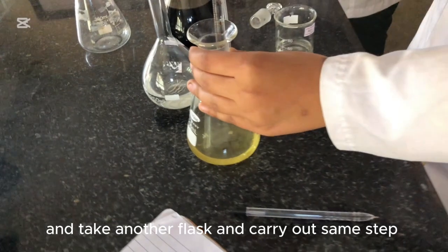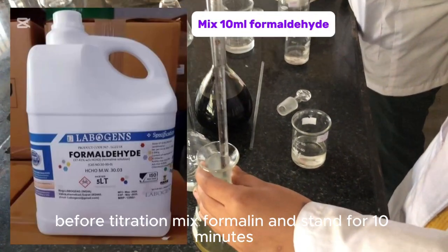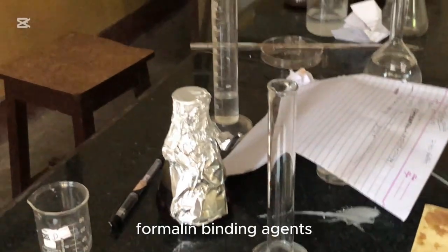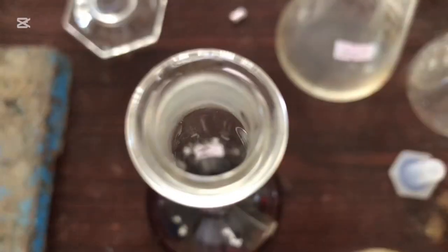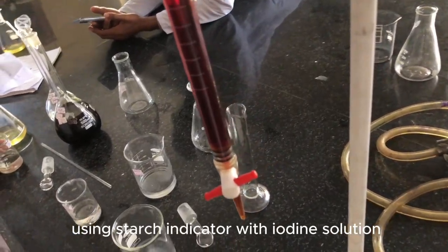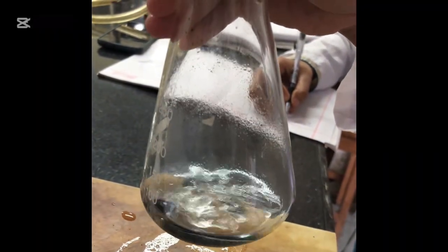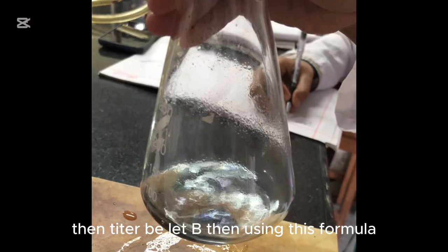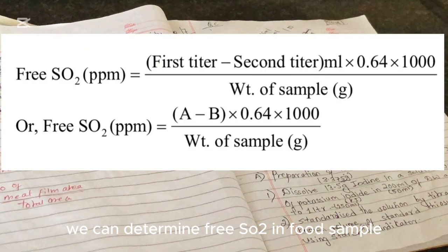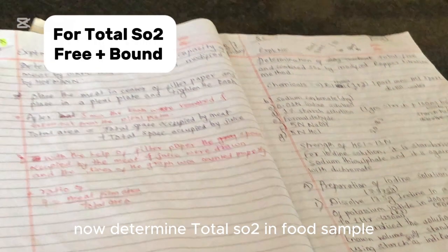Then take another flask and carry out the same steps. Before titration, add formalin and stand for 10 minutes — formaldehyde acts as a binding agent. Then titrate to a blue color endpoint using starch indicator with iodine solution. Let this titer be B. Using the corresponding formula, we can determine free SO2 in the food sample.